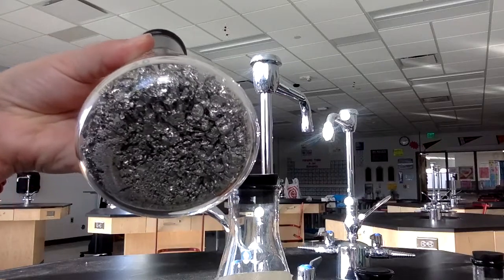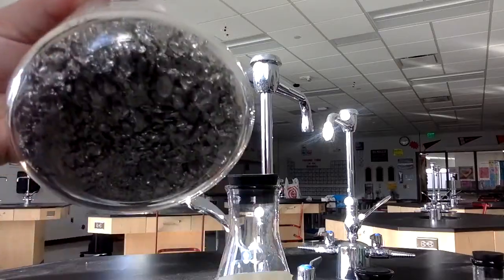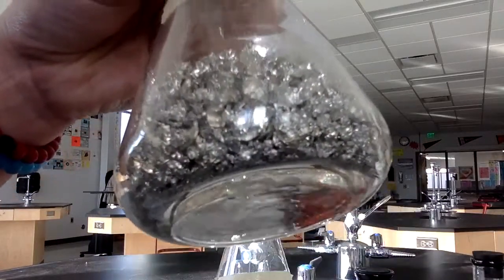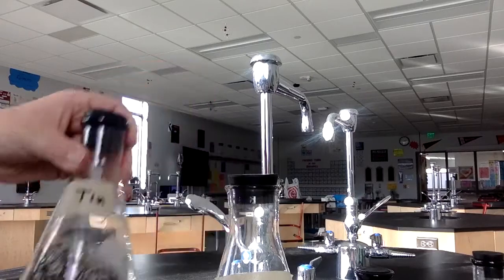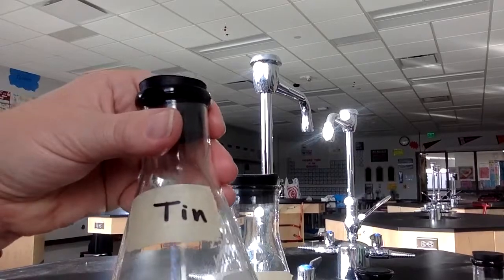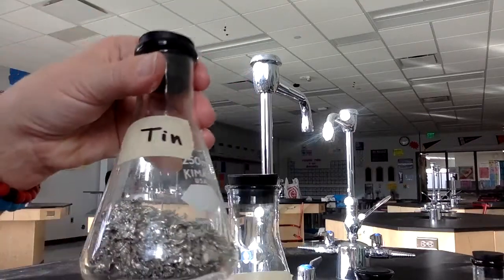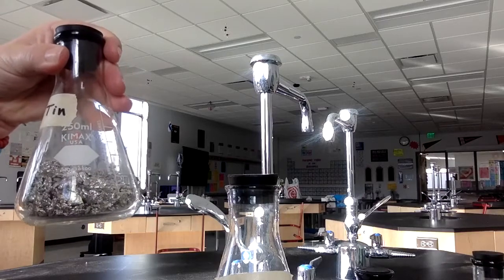So fill in the chemical formula for tin; you'll get that from the periodic table. The description is what you're filling in right now: that it takes up about 100 milliliters of space. It's kind of silvery, hard pieces. That's what you're looking at. All right. For mass of sample, you would have to get that from the periodic table just for tin. And then the number of moles is 1. And then you have to decide, would this be atoms, molecules, or formula units? Remember, it's just an element.